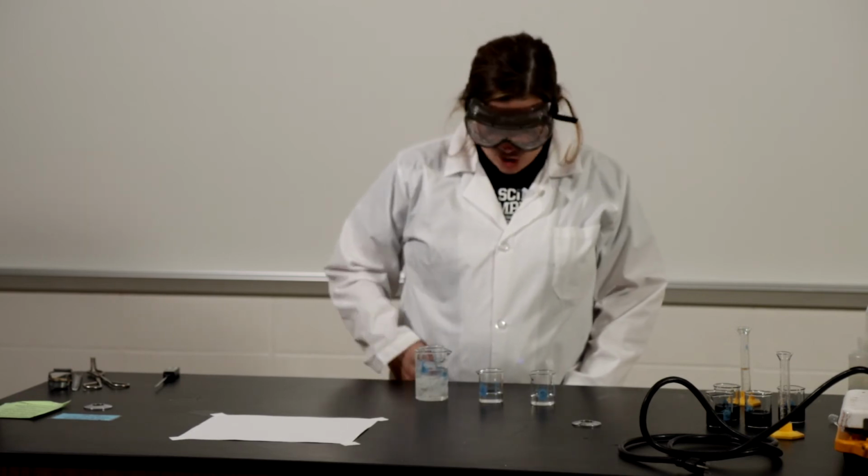For the second part of this lab, we are going to test how temperature affects reaction rate. When we're testing the different factors, it's important that we only vary one factor at a time. If we were to change the concentration and the temperature and the reaction went faster, we wouldn't know if it went faster because the concentration changed or the temperature changed. So for part 2, the concentration is going to be the same for all 3 trials.